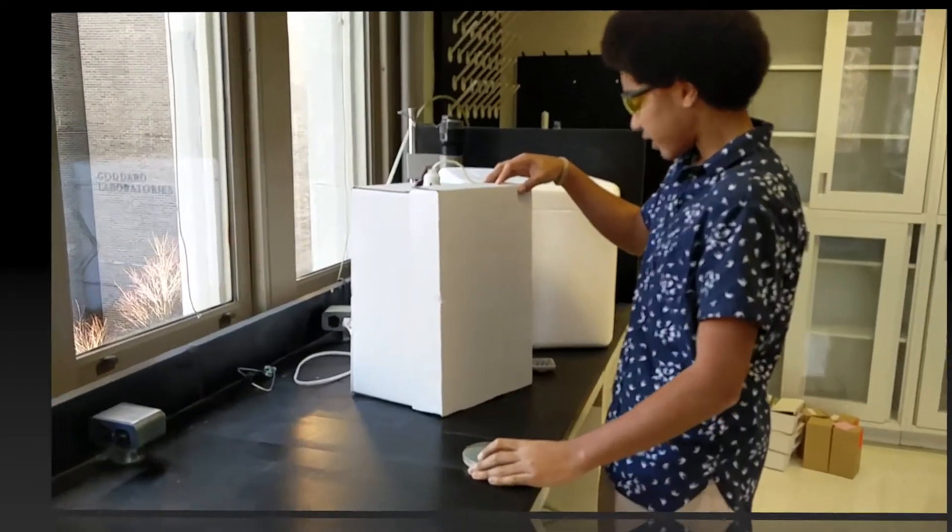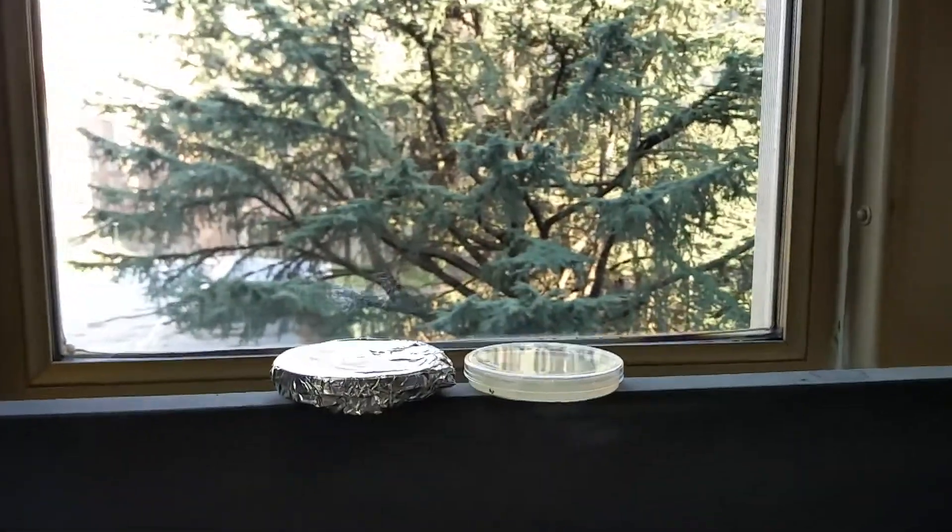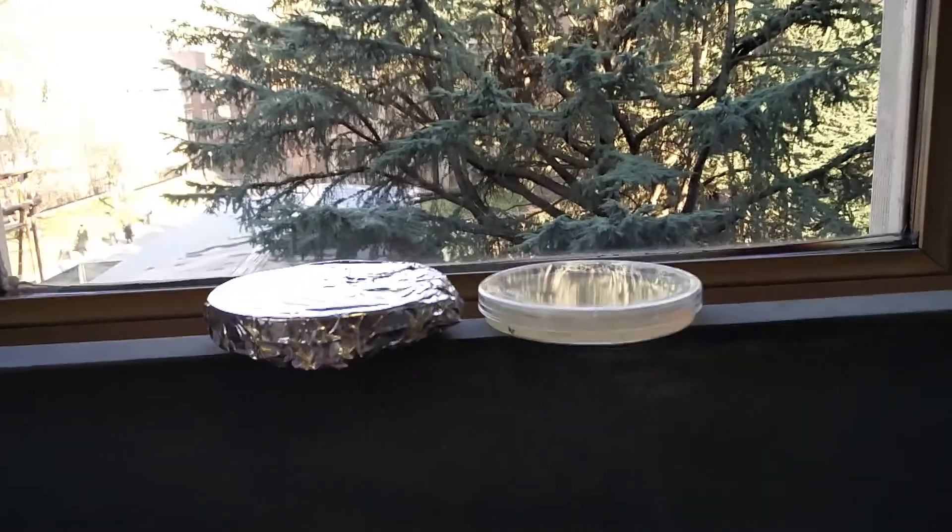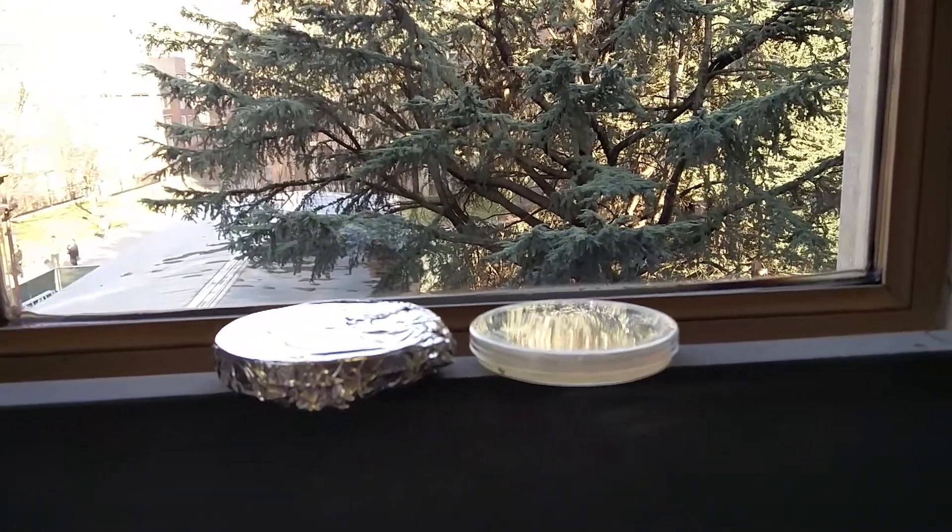Now I've finished with my light exposure plate, so what I'm going to do is put it right next to the no light exposure plate. Now my timer is set, and I'm going to come back after one and a half hours and put them in the incubator.